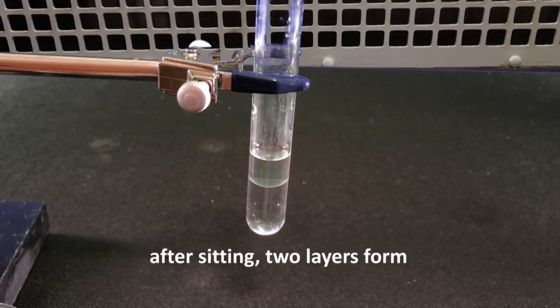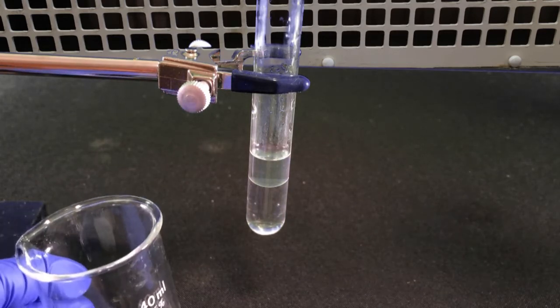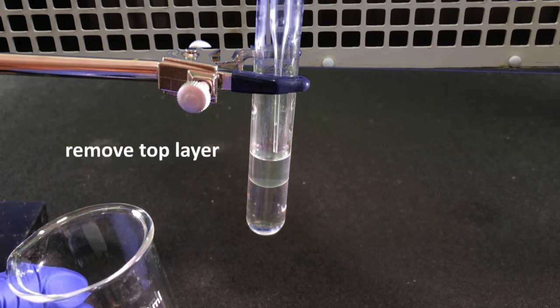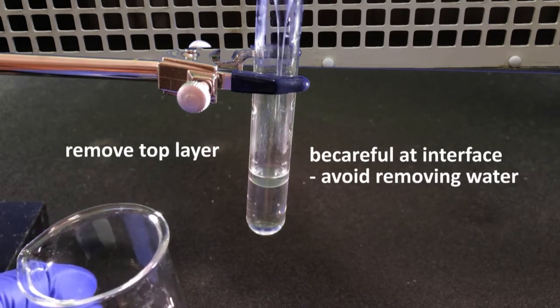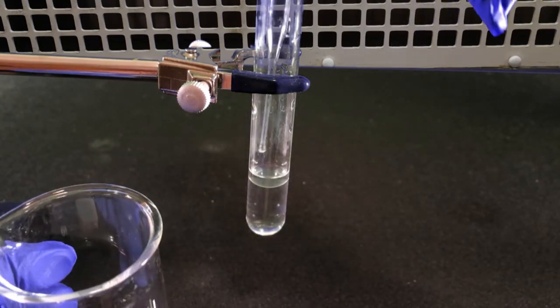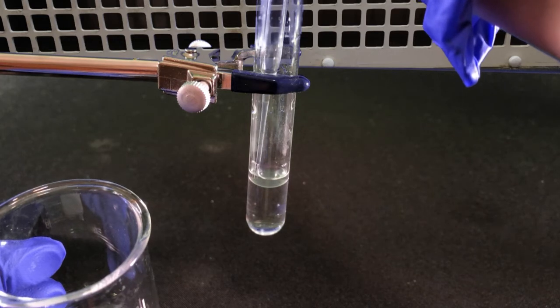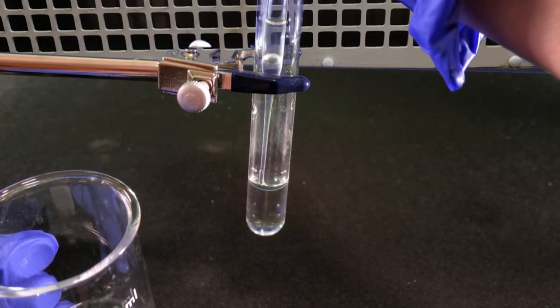Once 2 layers have formed, you need to physically separate the layers. Carefully pipette out the ether layer and place it in a clean vial or flask. Be careful not to remove any aqueous layer when you get to the interface. Since you will be extracting several times, it's better to err on the side of leaving a little ether than removing water. What's left in the test tube is the bottom aqueous layer.